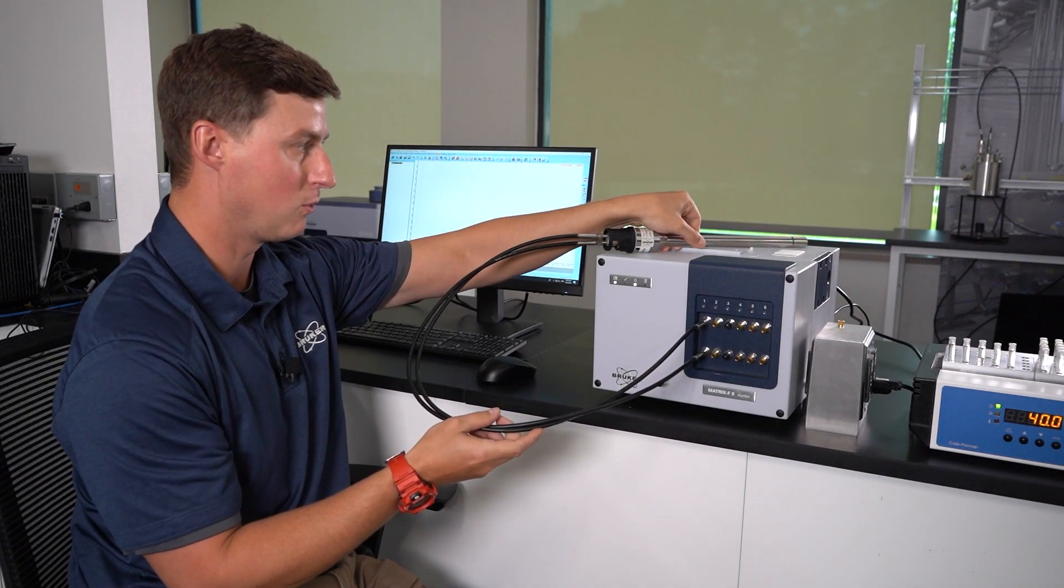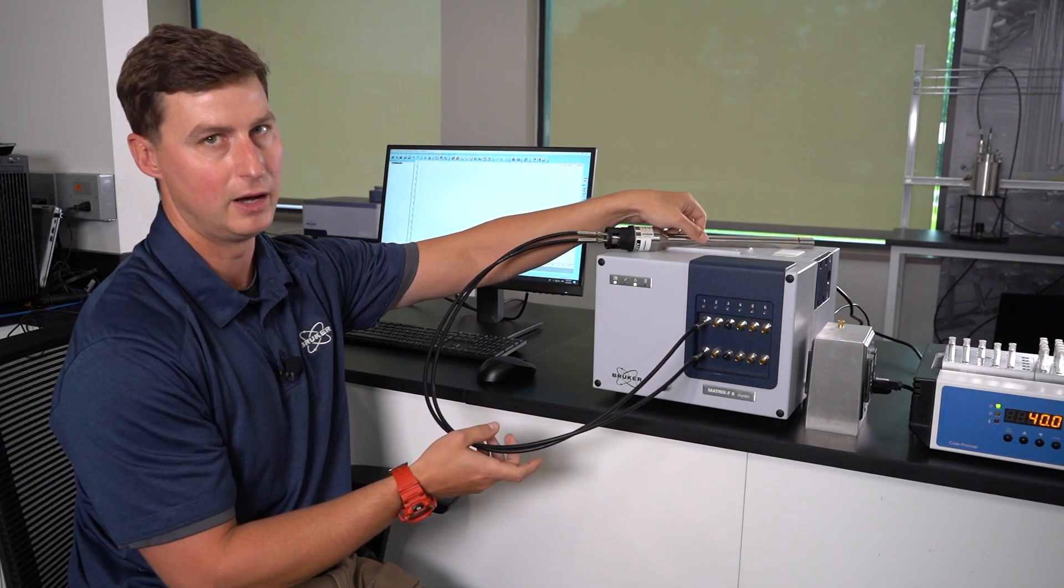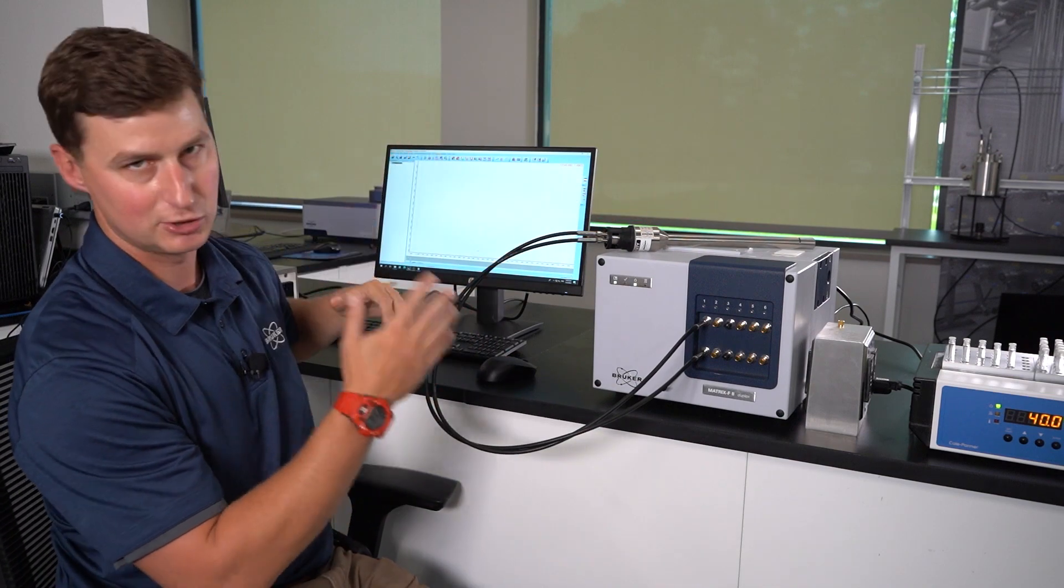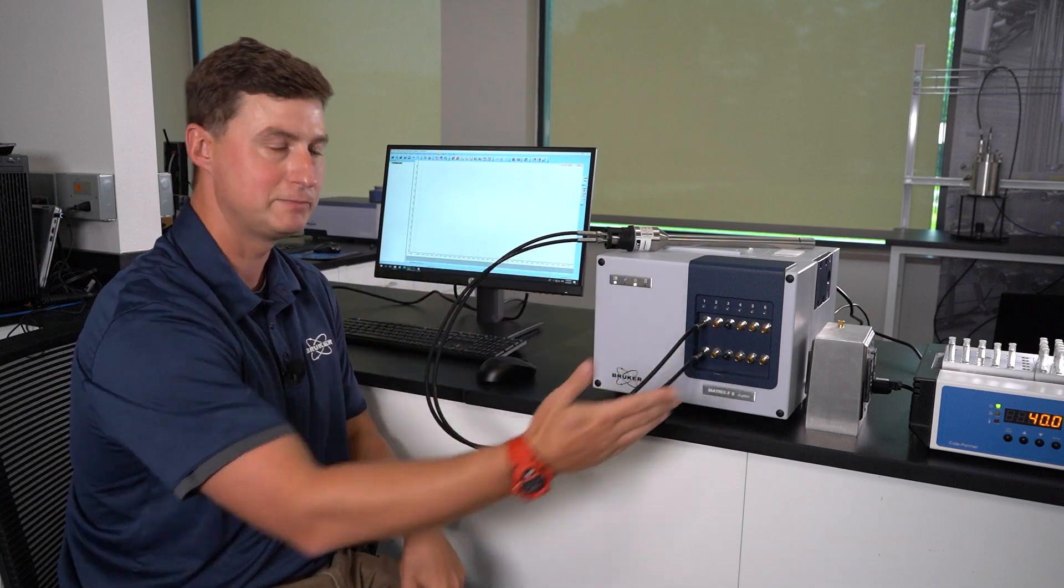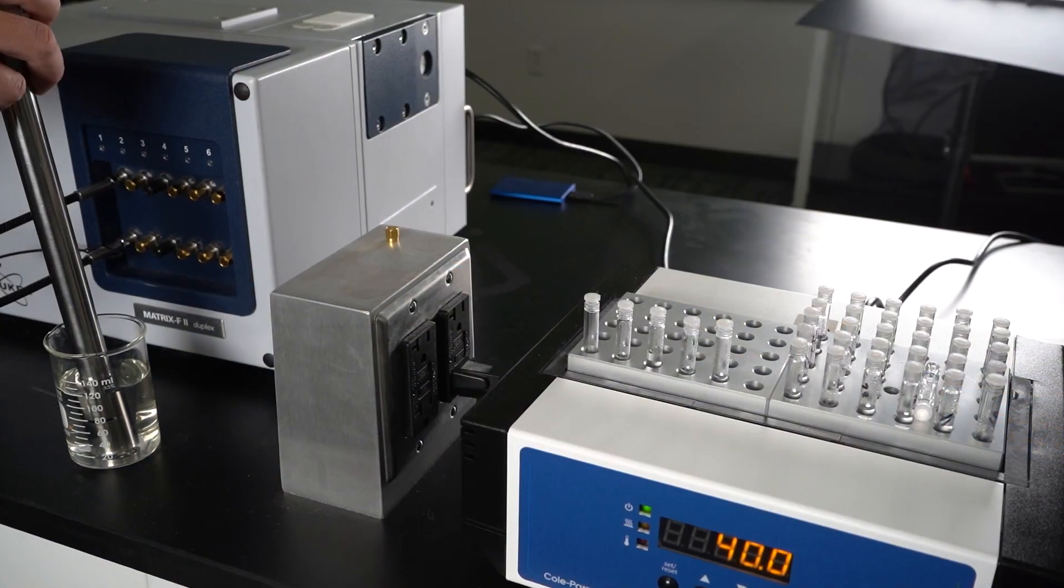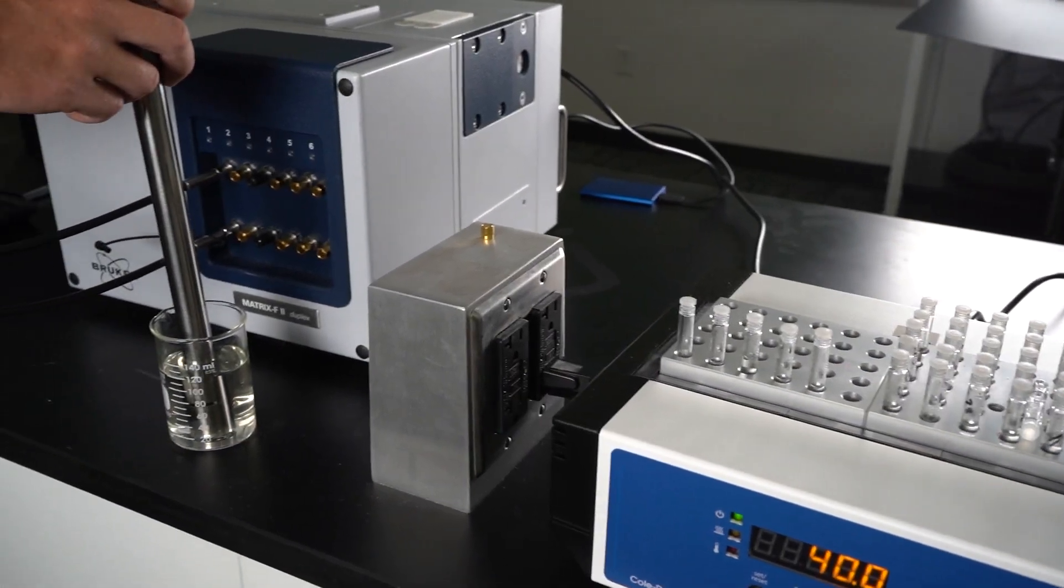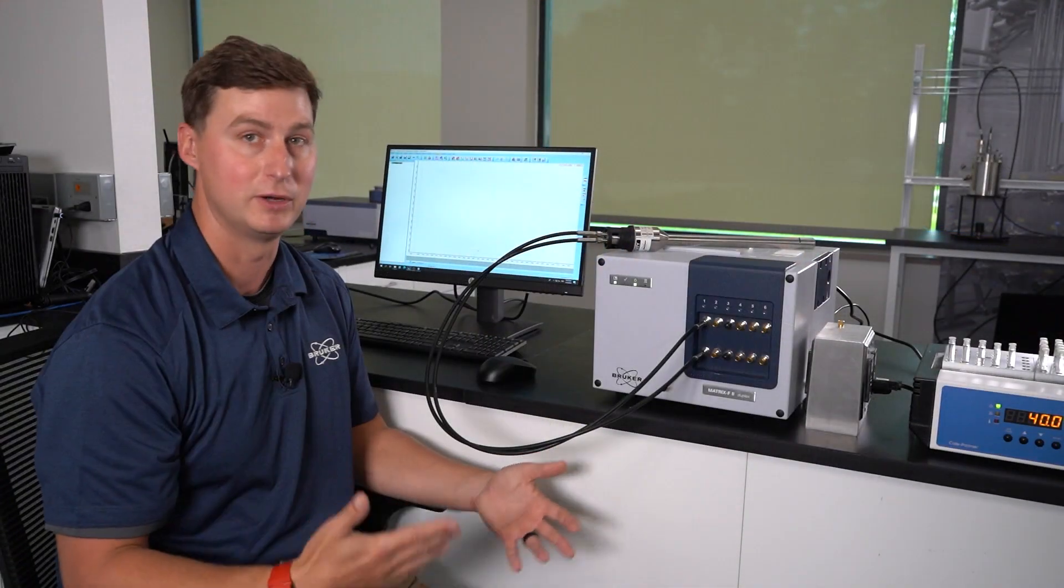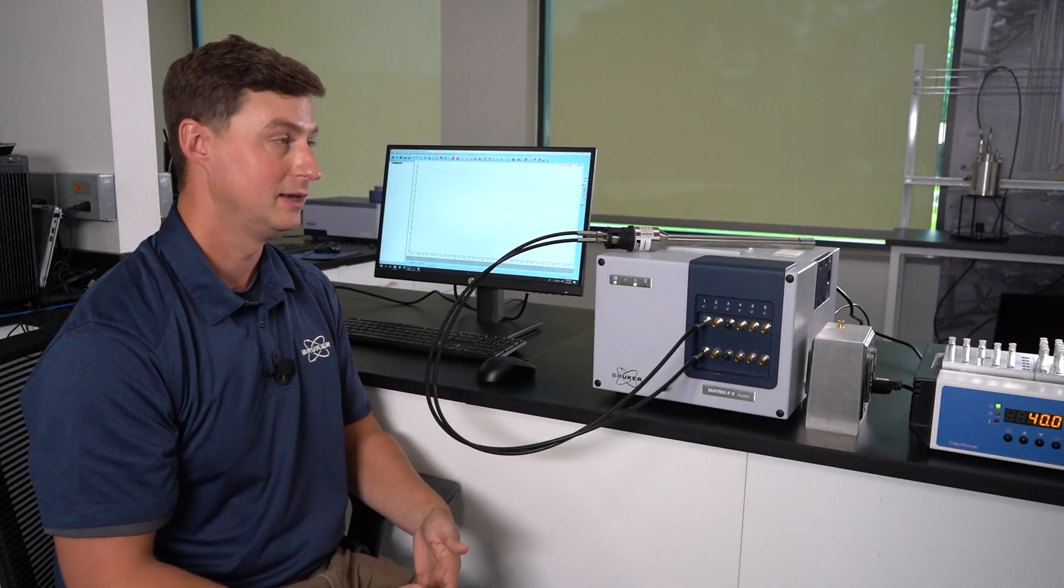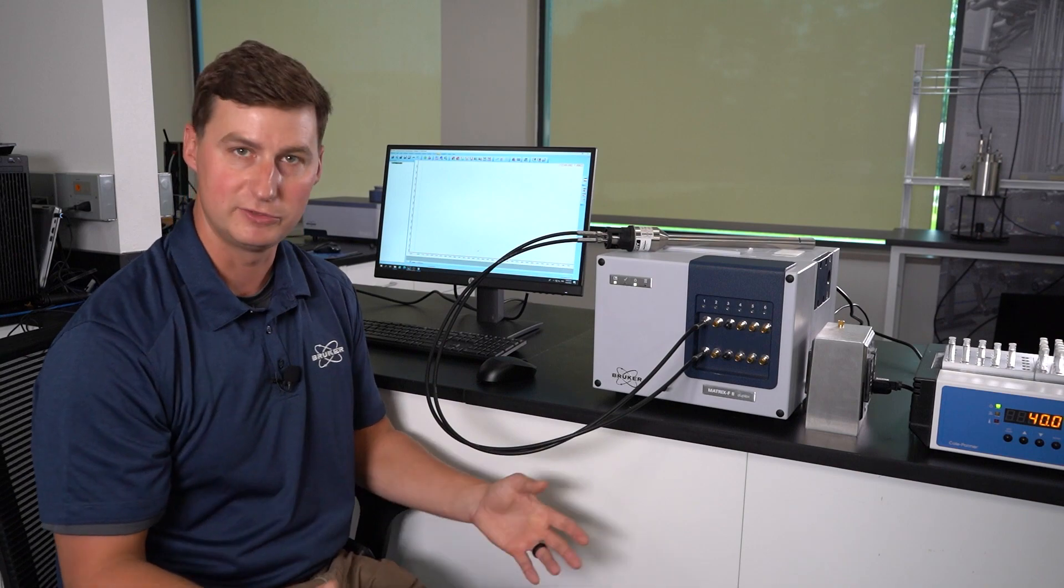We'll talk a little bit more detail later on some of the things to look out for when you do these types of transfers. I've already prepared six samples. In actual transferring of these models you probably want to do more like 20 samples, but for the purpose of the video we're going to do six.